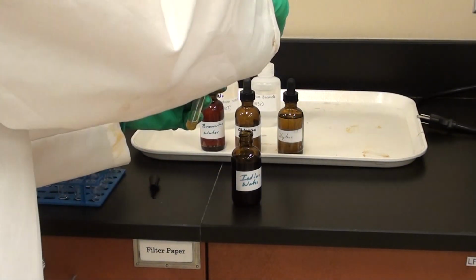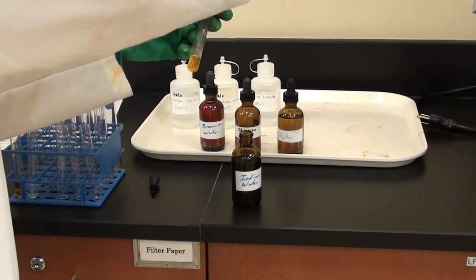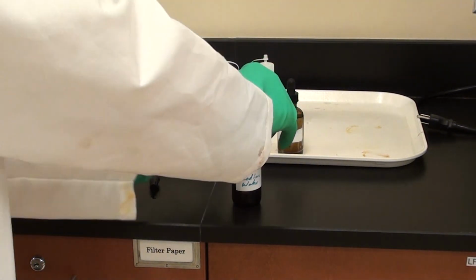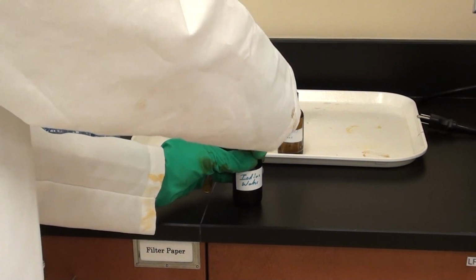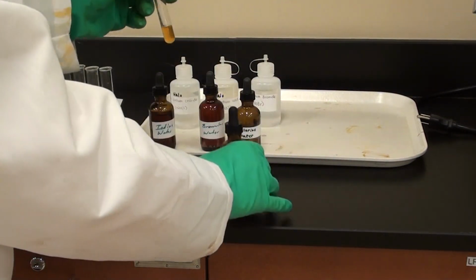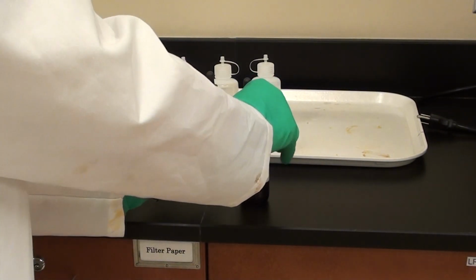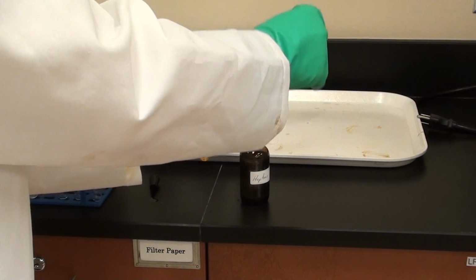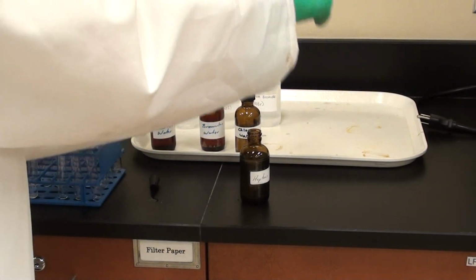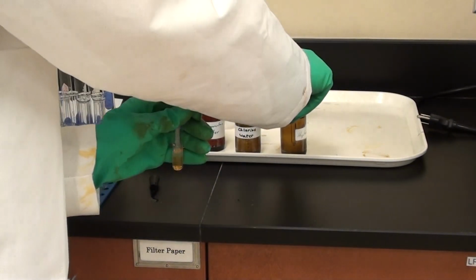Now you'll notice the iodine water is a pinkish color? Not right now. It's kind of an orange. Orangish. Okay. Right. So it's an orangish color on the bottom part. Now we're going to go ahead and add the hexane to this. As I said, it could be hexane, heptane, cyclohexane. Yeah. I added 1 squirt.